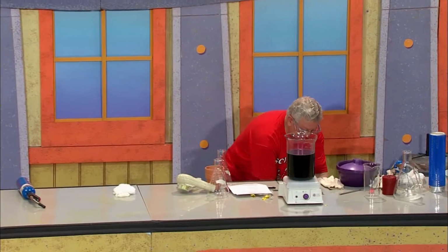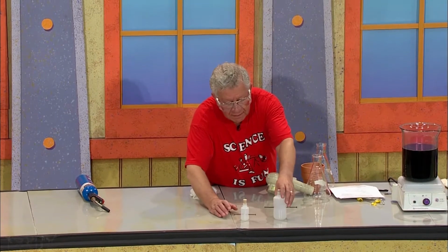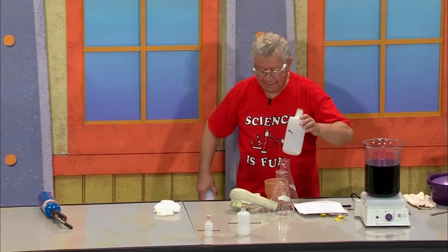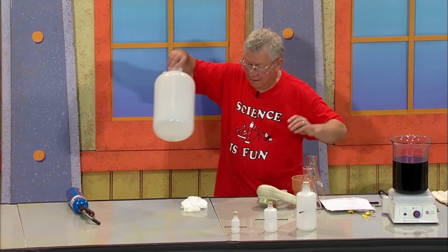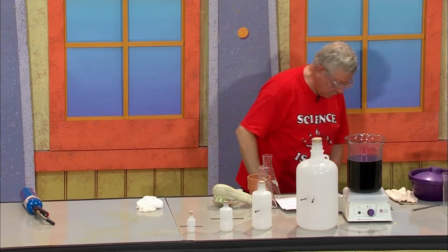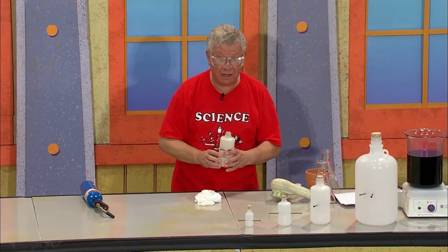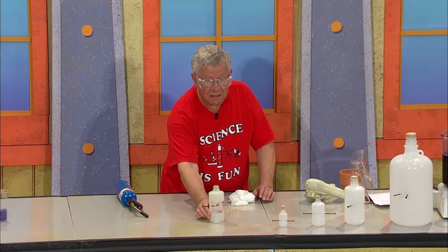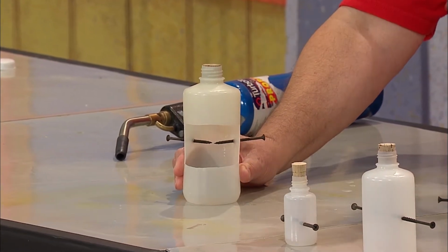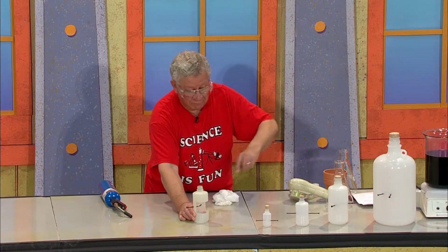Now I'd like to do an experiment with small plastic bottles. Here's one. Here's another one. Here's a bigger one, and an even bigger one. These bottles have screws inserted in them, but they're not touching on the inside. They're separated by a distance of about half a centimeter. There's a cork on top of each one, and a clear and colorless liquid at the bottom of each of these four bottles.